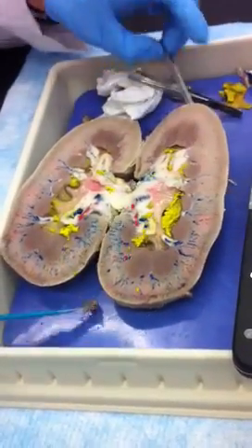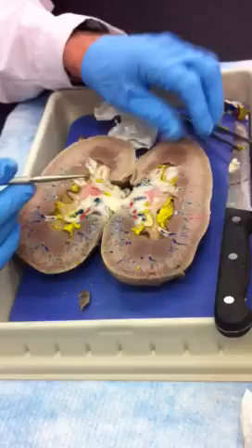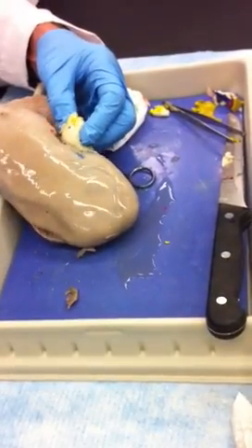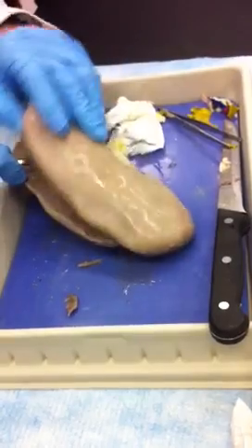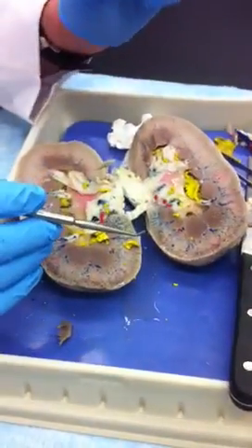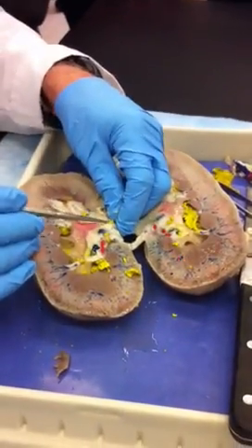If you watch — if I slice here — if you watch when I come through here, you'll see I'll come out right through the ureter that I've shown you before. Notice how grooved that thing is. That's because the ureter is constricted, and it has a little irregular corrugated lining to it. You can see the lining right there.